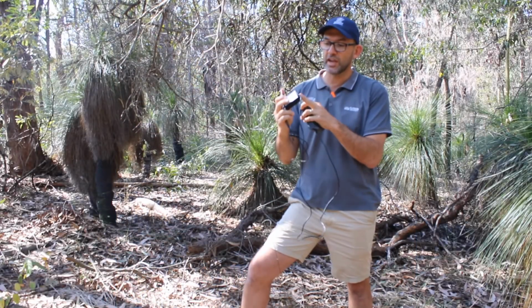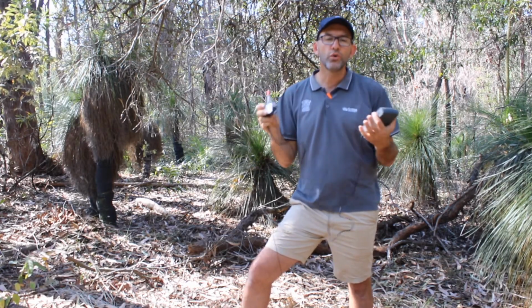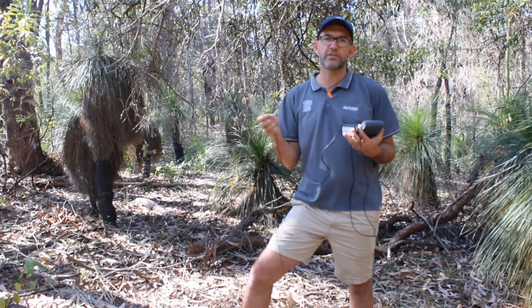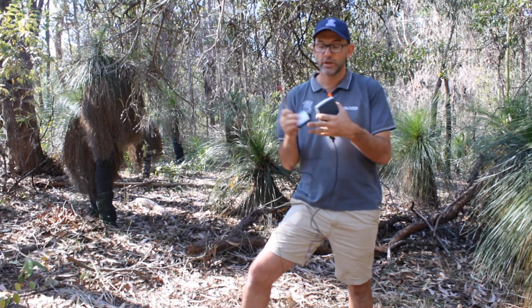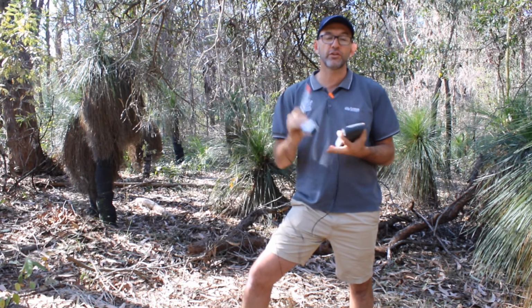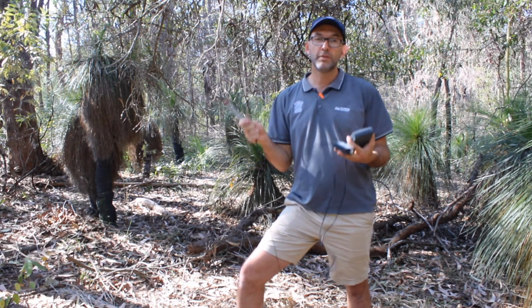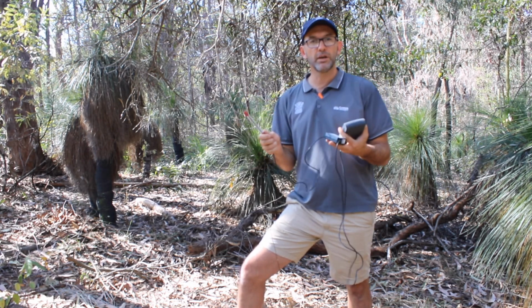If you have this set to anything else, it has a maximum value, for example, of 6,000. All you get in all your sites is 6,000 because all your readings are well over that, and that's the maximum setting it'll read. So make sure in this box that you turn it to 0 to 150,000, hold that towards the sun, measure the light intensity, and that's the last abiotic factor that you'll need to measure with your Vernier LabQuest.